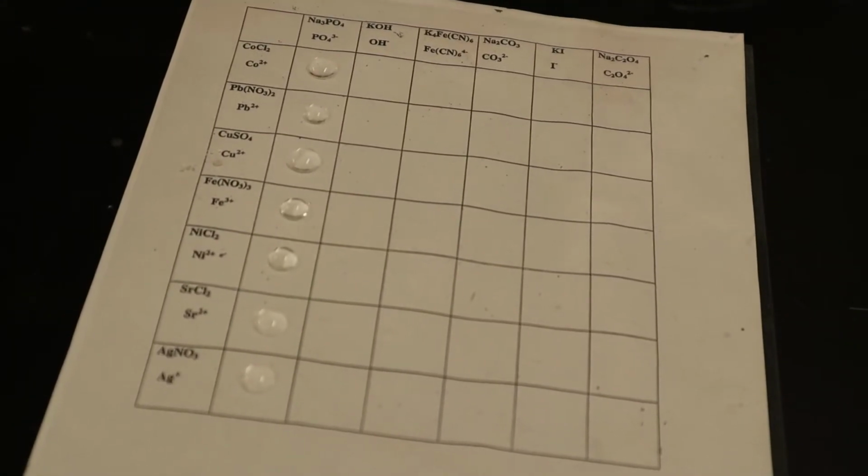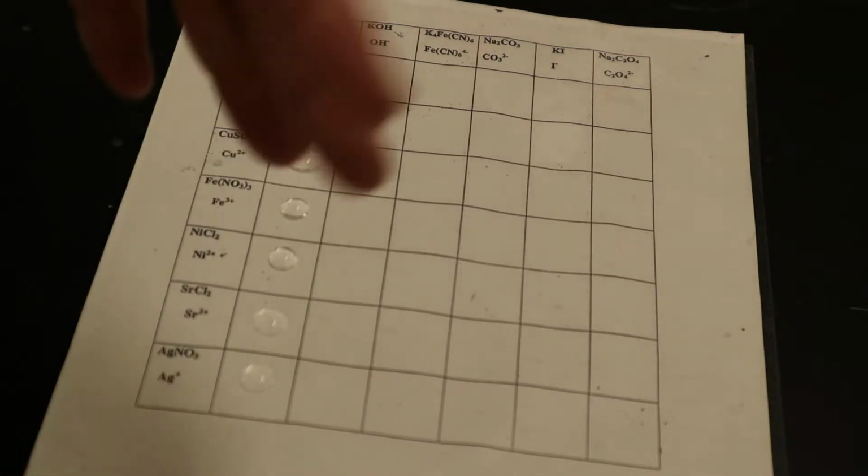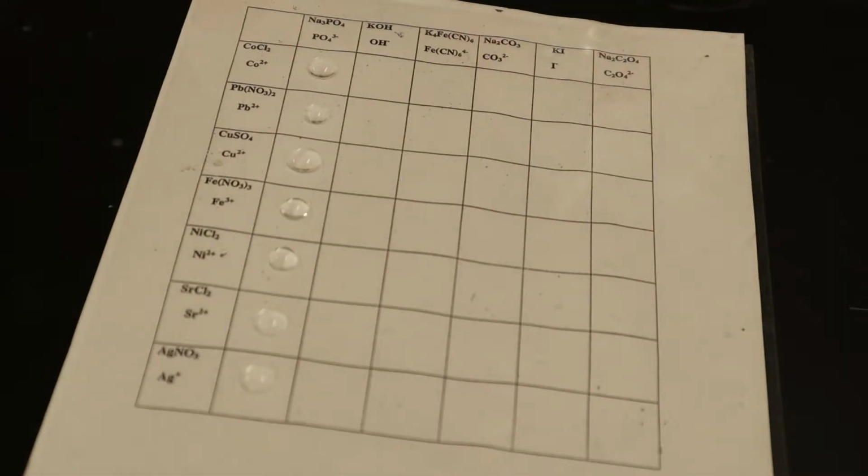Do you want to be adventurous and do all the downs first, or go across? Here's KOH, which is the second one. Okay, KOH is the second one. So we're pretty much just setting everything up, right? But you can see how it works as you go.